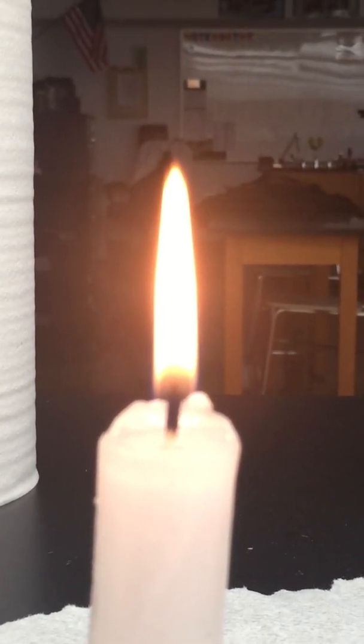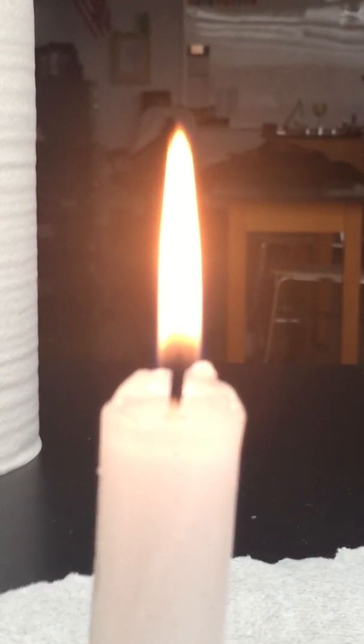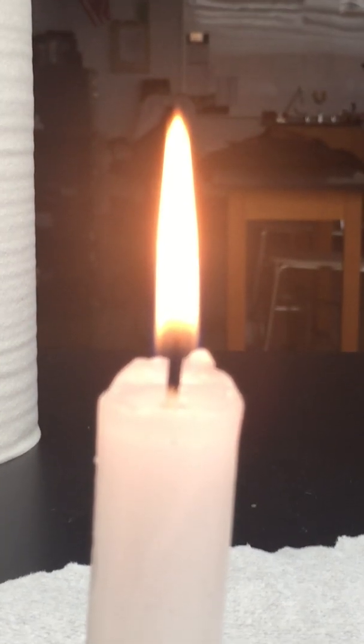Okay, so note the color of it. If you want to fast forward to the end, you can.